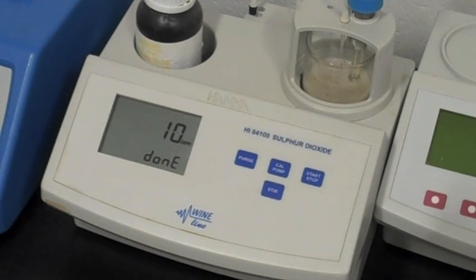And then what we're going to do with this number is calculate by how many gallons we have in the tank and add approximately 40 parts per million to this batch of wine and let it sit for a while.